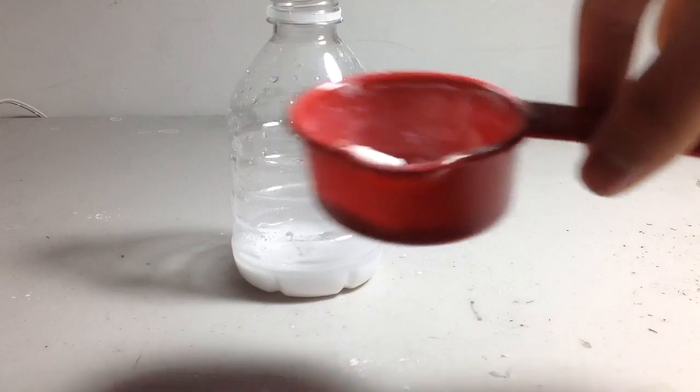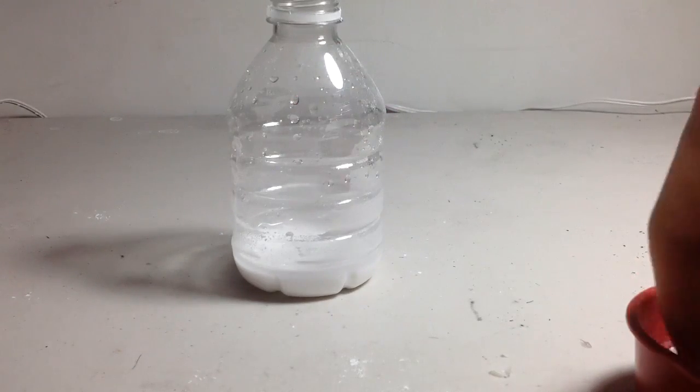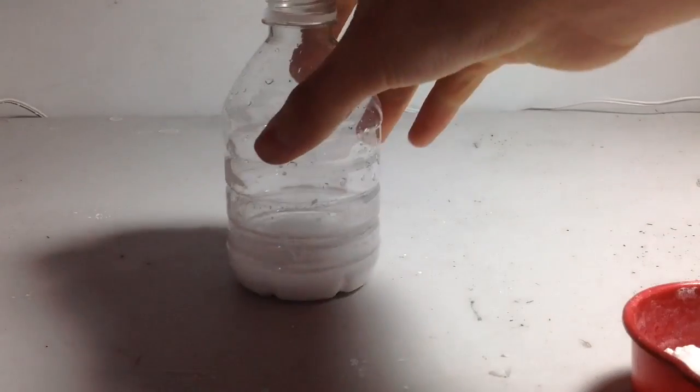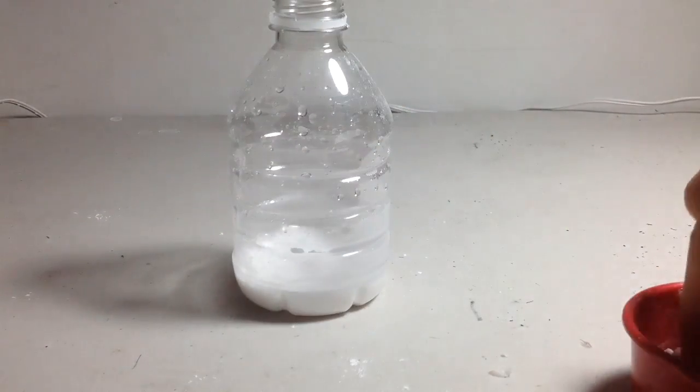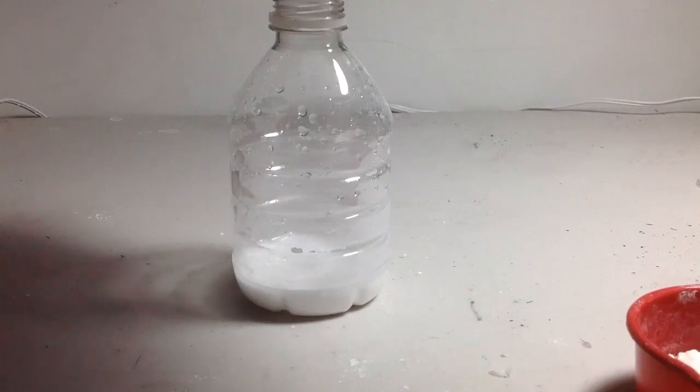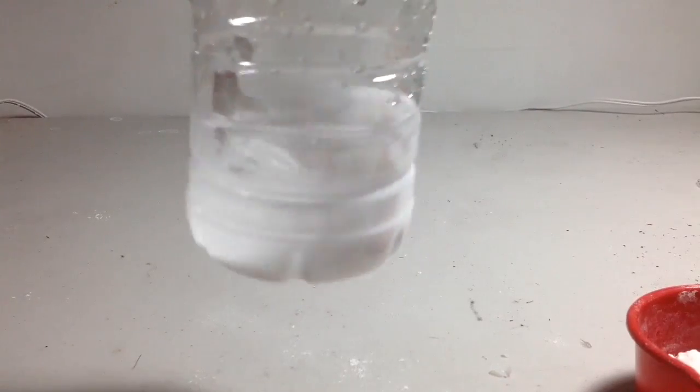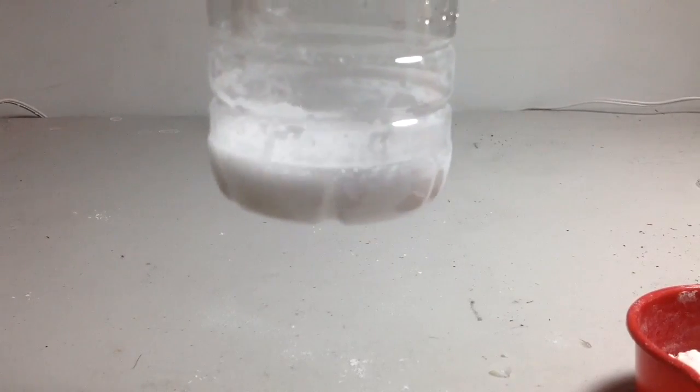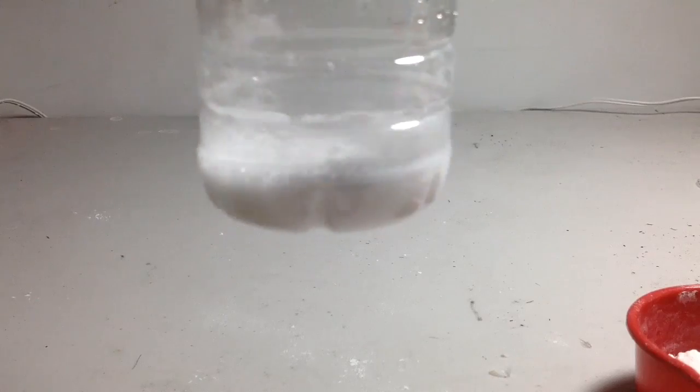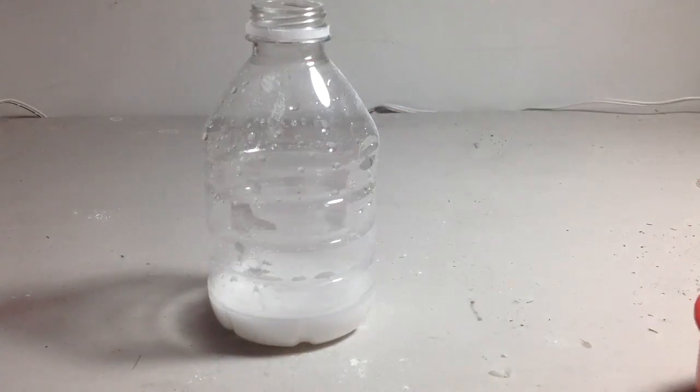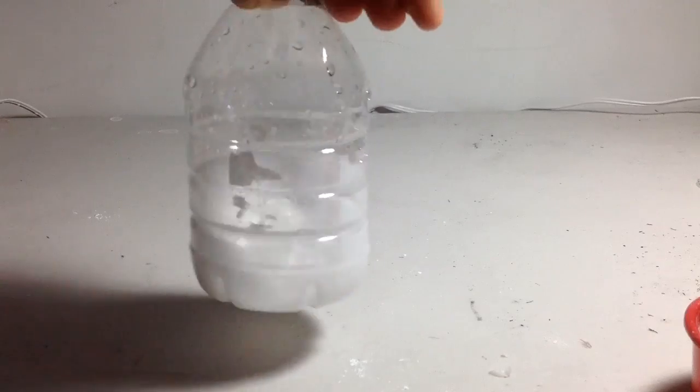Here's the sodium carbonate. You could drop tiny bits in and there should be bubbles. You're going to wait for the bubbling to stop, and then once it's stopped, you're going to add in another pinch of sodium carbonate. Then it's going to bubble again. You wait for those bubbles to stop and so on until despite adding more sodium carbonate, the bubbles stop coming out altogether, which means that the reaction is completed.